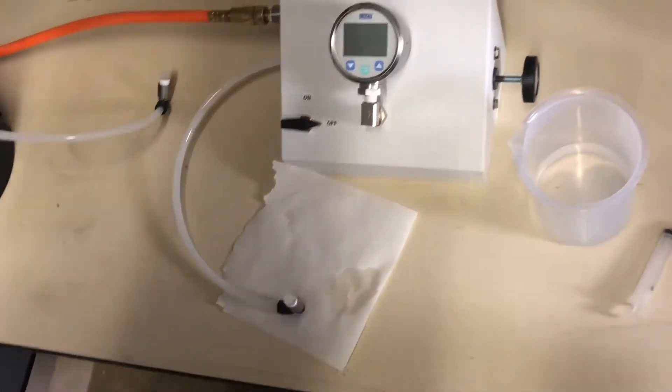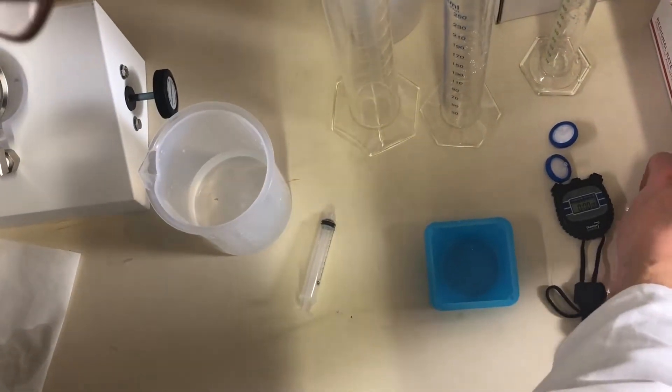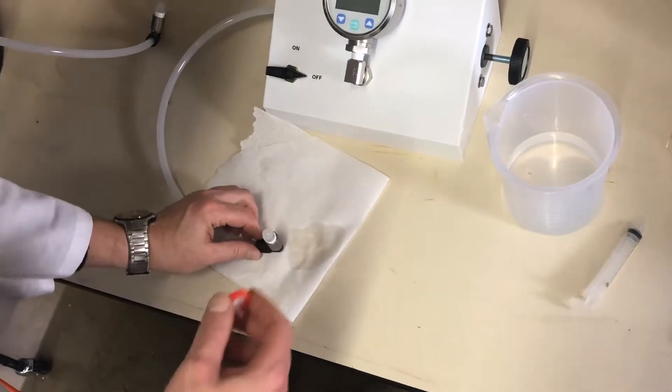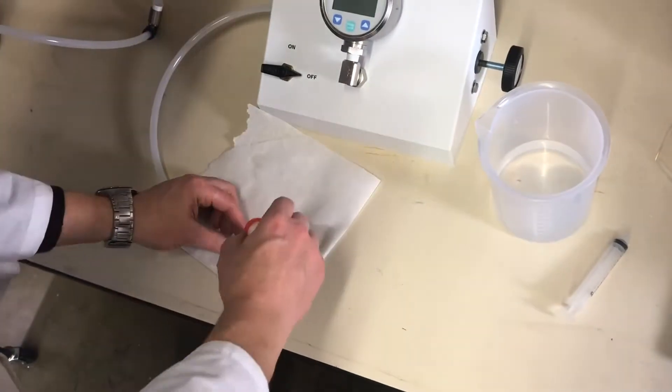Then we'll get our hydrophobic filter. In this case, it's a PTFE membrane. And then while the fitting's facing up, we'll attach the dry unused filter, a new filter.